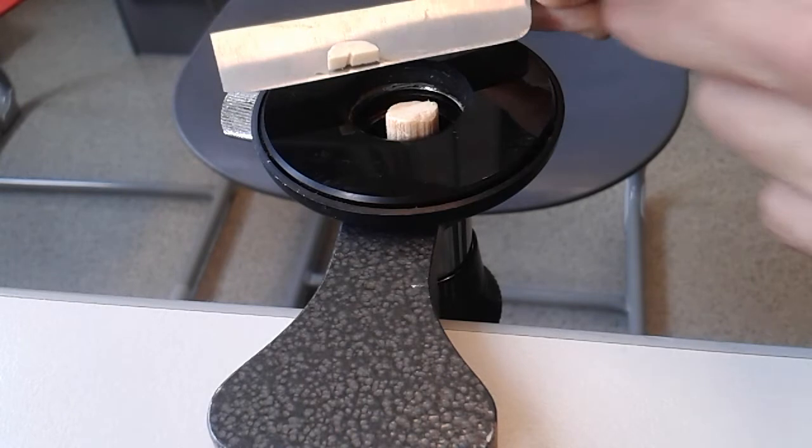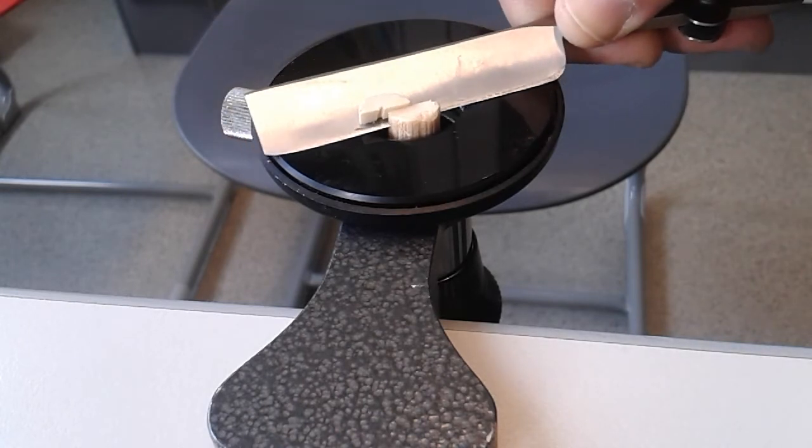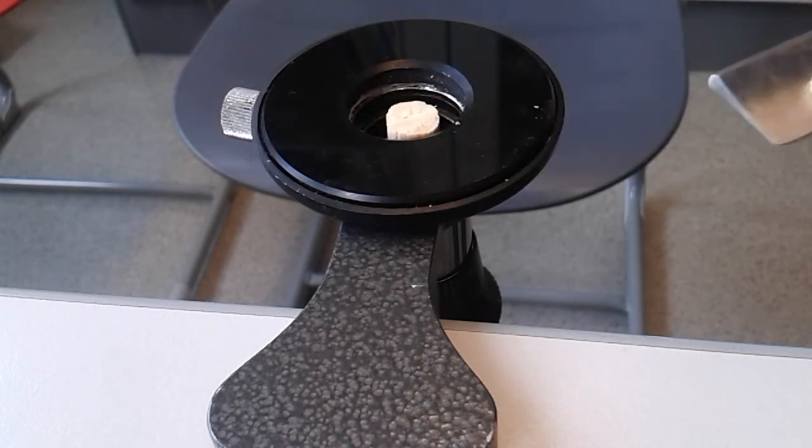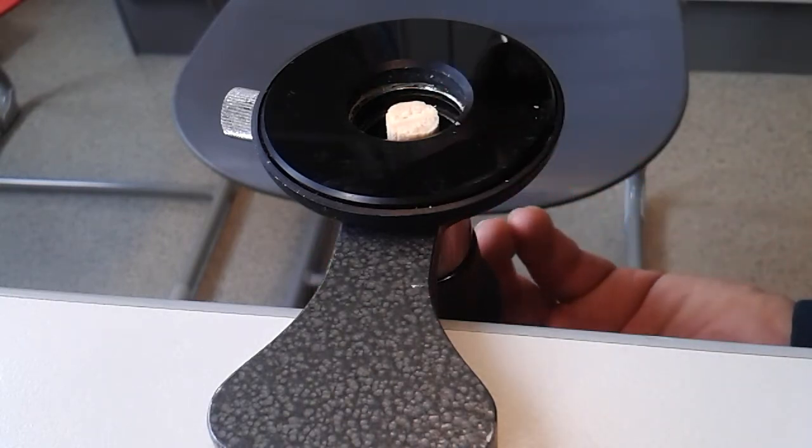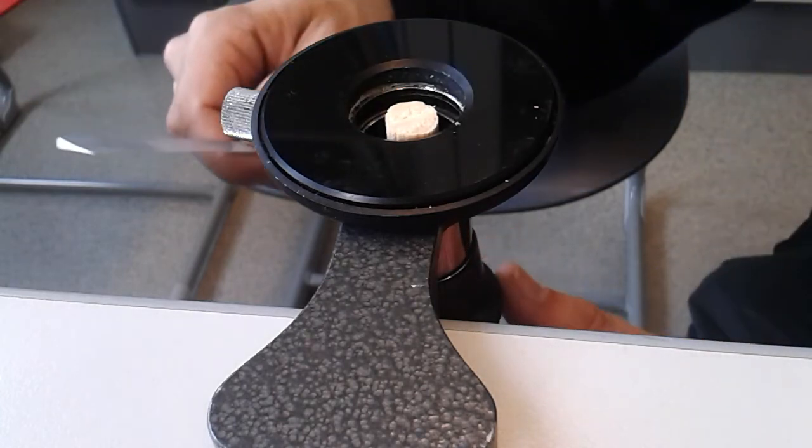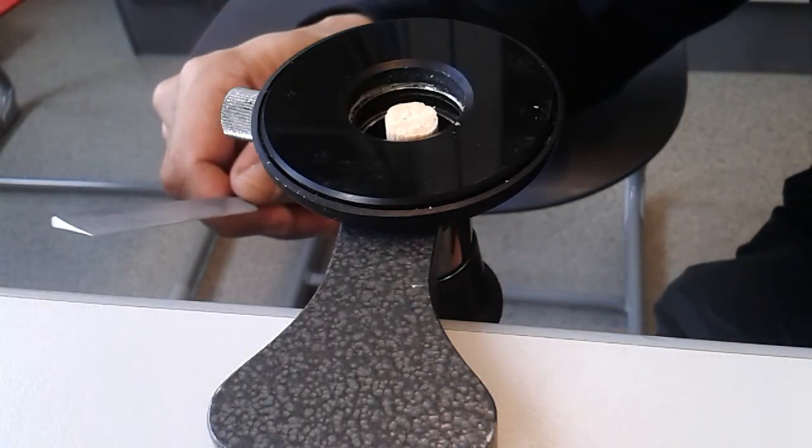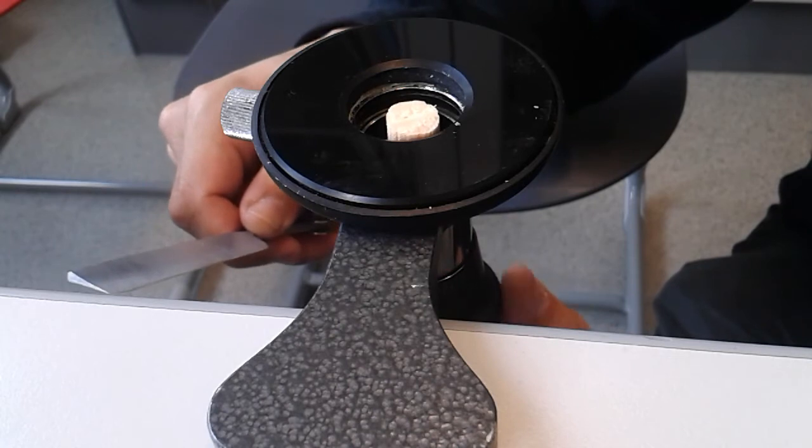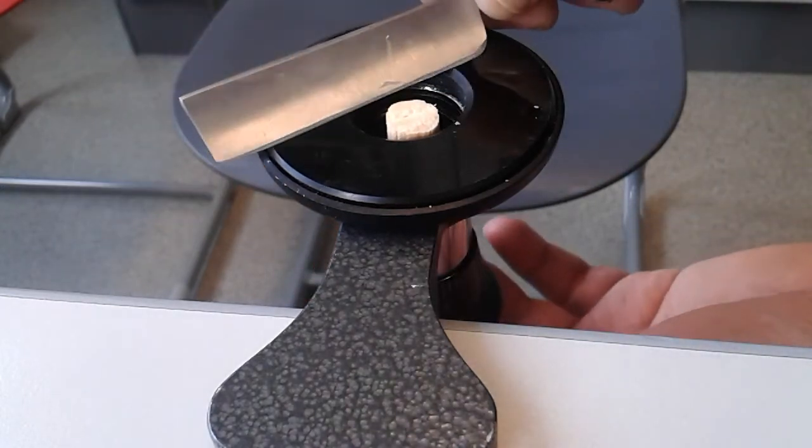You can see that it has already been split in half. In order to raise the specimen, I have to turn the wheel here at the bottom. I do not know which direction now. I have to turn it right. This I think is the right direction.